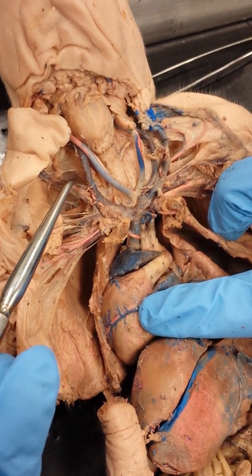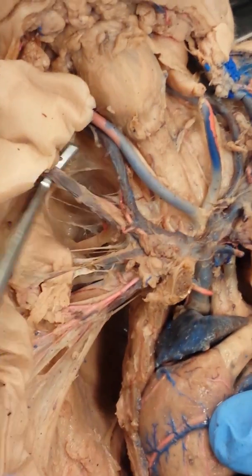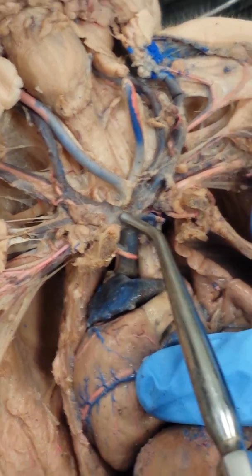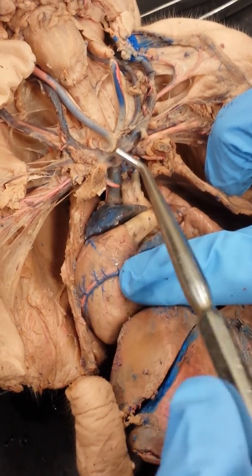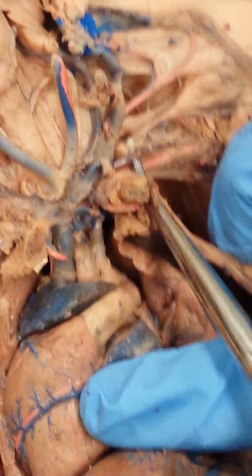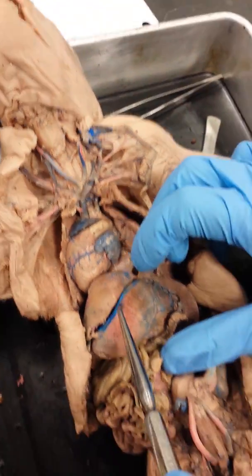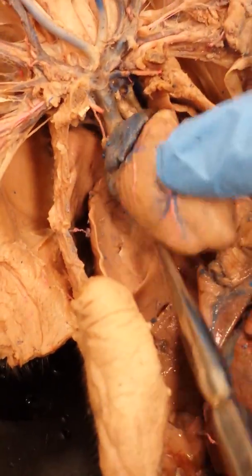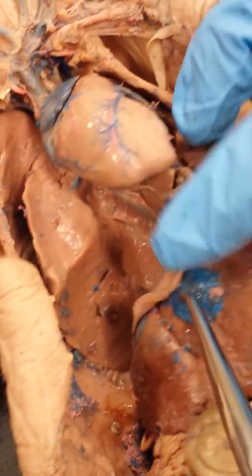So we have the internal jugular vein, and if you go a little bit more outward, we have the external jugular vein. Okay? Now, we're not looking for it, but there is a subclavian vein, but once you pass the ribs, you are called the axillary veins. Okay? Let's take a look at the veins below the diaphragm. So we have anterior vena cava above the heart, so we have a posterior vena cava below the heart, so let's follow that down into the abdomen.